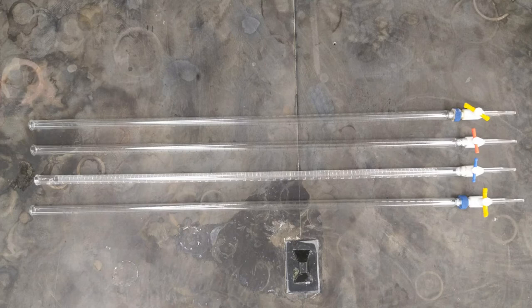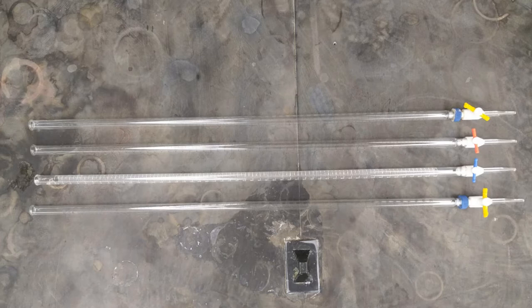In this video, we'll demonstrate how to set up and operate a burette. Burettes are typically used in titration experiments to precisely measure the volume of solution that has been added to a reaction vessel.